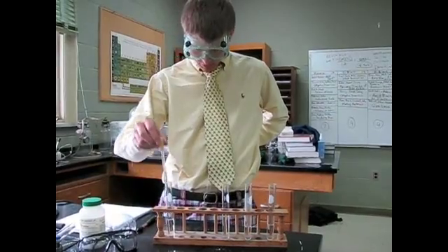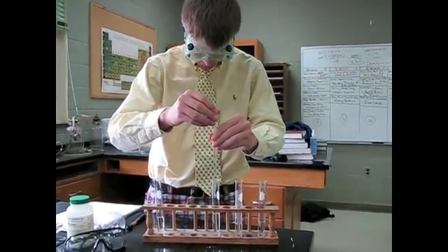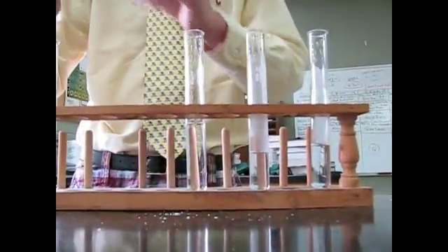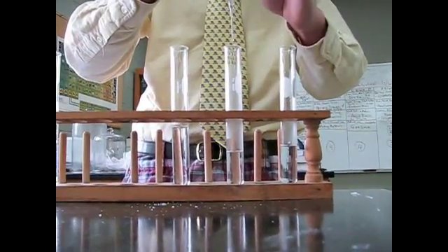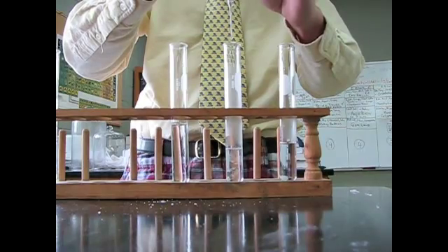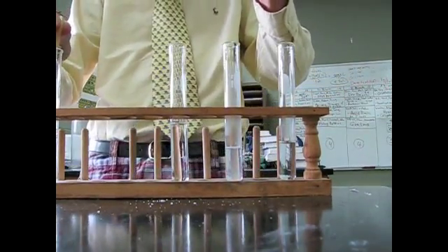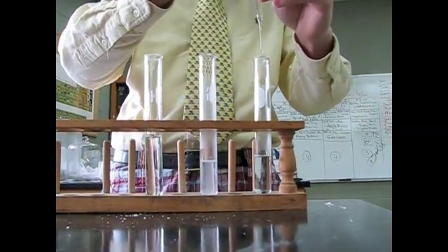So here we go. This is in deionized water. The original salt solution clearly has chlorine ions in it and this is the distillate.